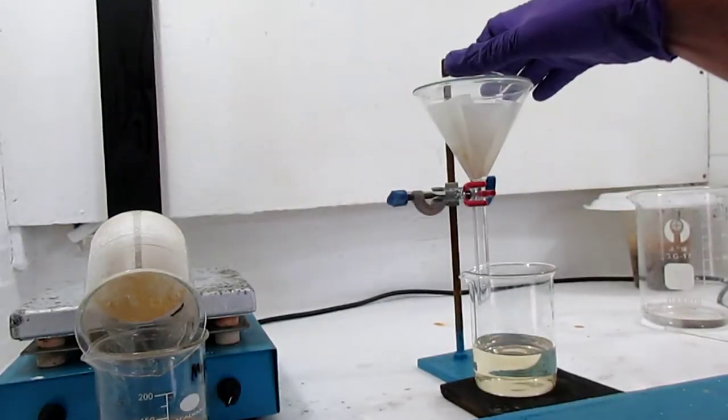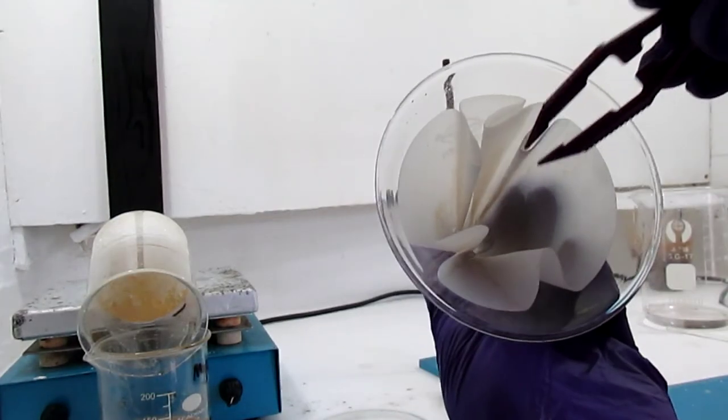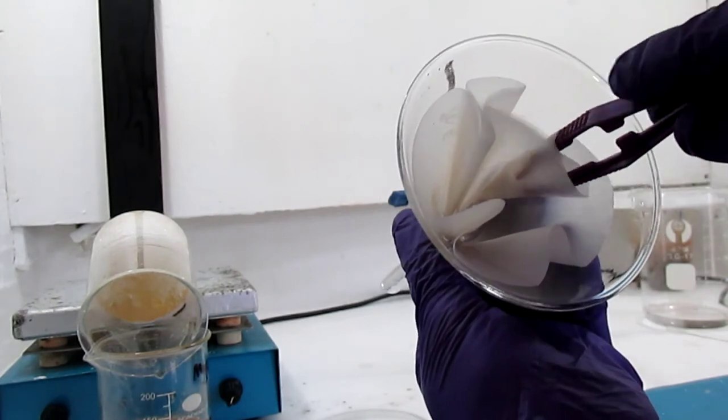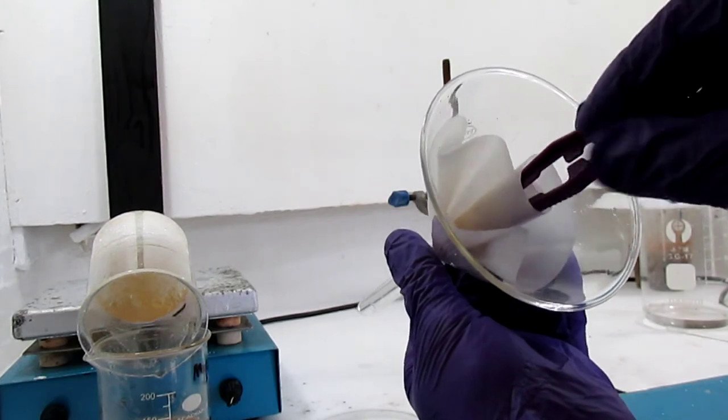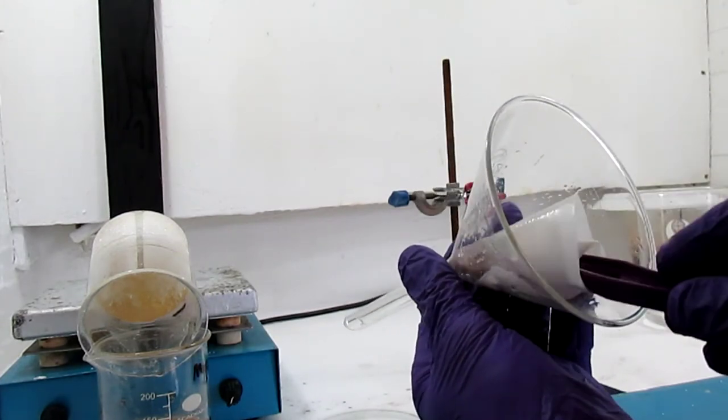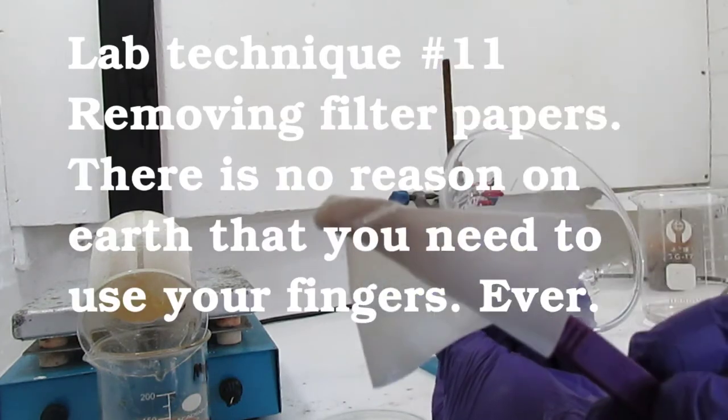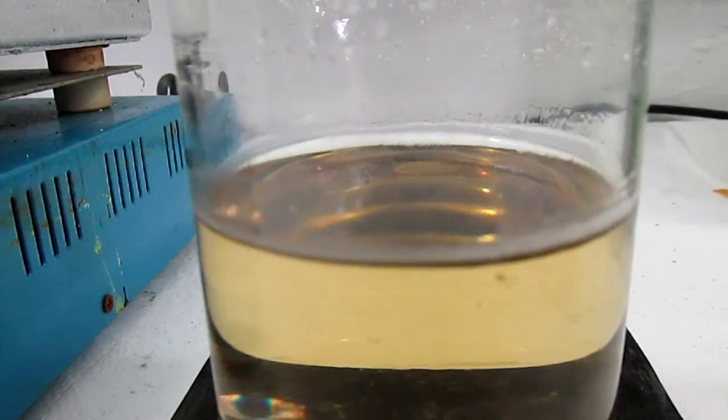Gloves are kind of a final backup device to protect your hands in case of some strange bizarre accident. They're not a magic force field to protect your hands nor prevent contamination of the thing you're trying to make. There is absolutely no reason ever to stick your fingers into a chemical mixture of any kind.